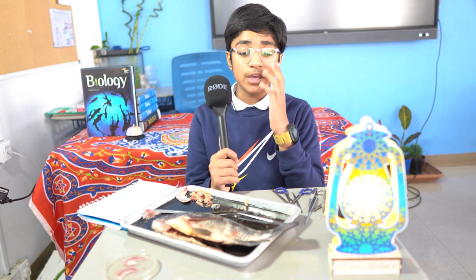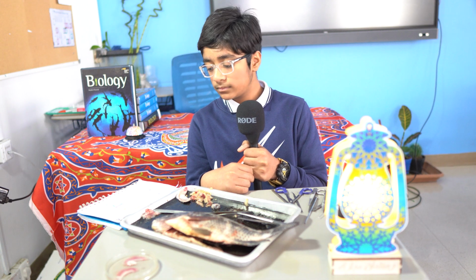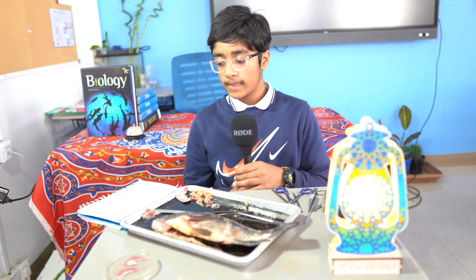The anus is actually very important for identifying the gender of a tilapia fish. Male fish have only one, which is to excrete waste, while female may have two, which is to lay eggs with the second one. Yeah, exactly. The anal opening is the last opening of the gastrointestinal tract or the alimentary canal. The second one in the female is for the eggs, which is a part of the reproductive organ. Yes, thank you. Carry on.